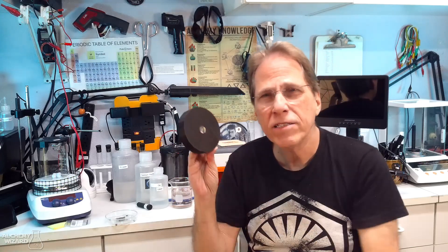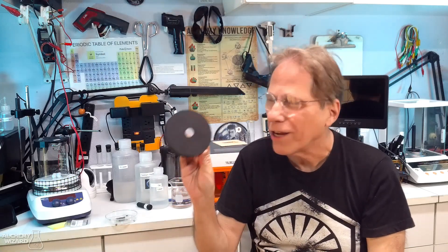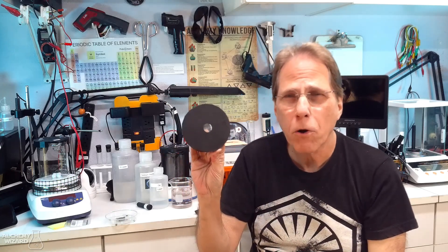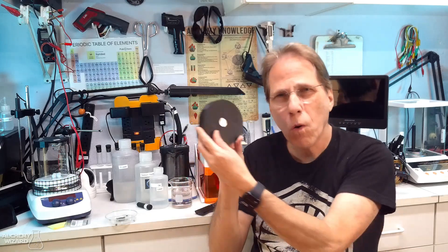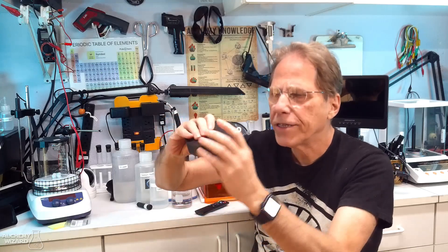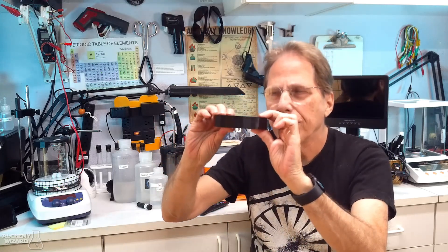Now it's not a very big hole because we're trying to keep that blue laser light from escaping. But I have found that you don't really need to move the laser very much. A 10mm square over your sample is going to be fine for creating nanoparticles. You don't need to cover the whole entire sample. So the small hole helps us. Then you're just going to take your top and you're going to put it down like this and there you go.